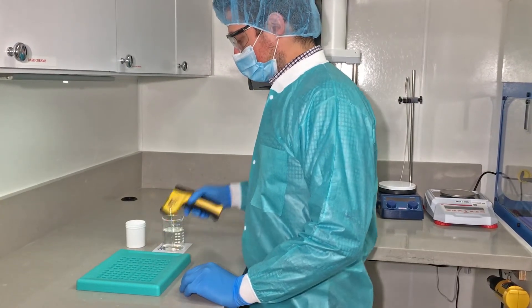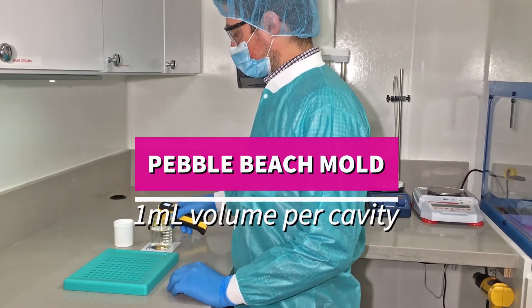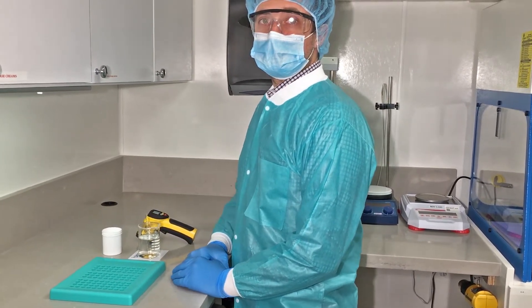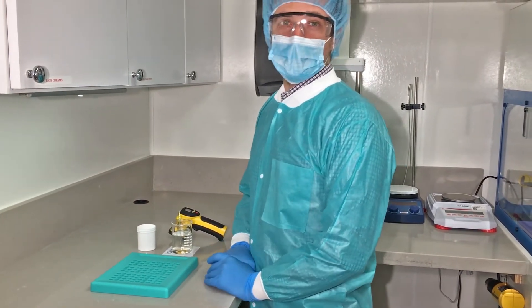Today Alex is going to demonstrate how to use one of our latest molds. This is the Pebble Beach mold — 1 ml per cavity, total of 100 cavities. What type of base are you using today? So today we're using a PEG base from PCCA.